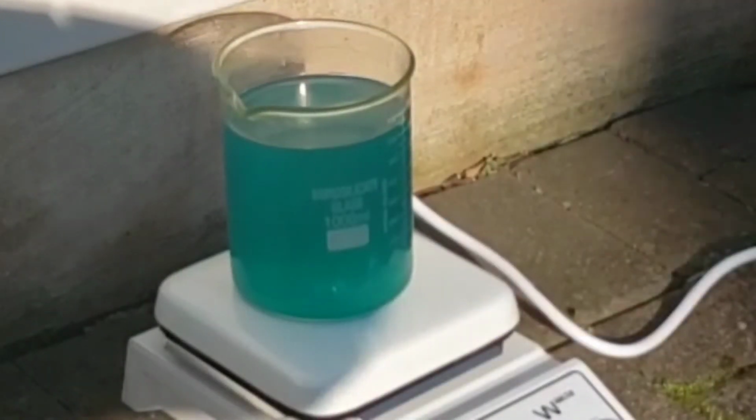Having gained a little bit more knowledge about chemistry, and a cool hot plate, I decided to try it again pretty recently. Because genuinely, it's a really simple thing to do, it's like a really basic elementary school student home reaction, but it annoyed me that I messed it up. So I put it in a borosilicate beaker that could handle higher temperatures, and on a hot plate, and set it to a temperature that was high enough to boil it fine, but low enough to not break the beaker, of course.